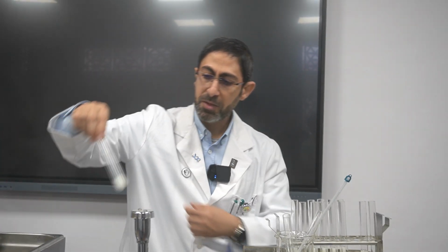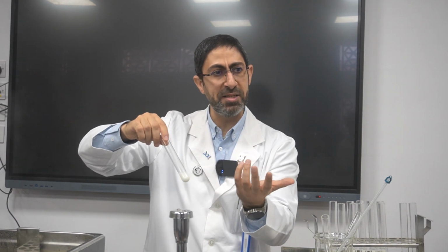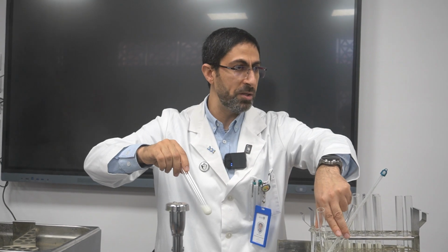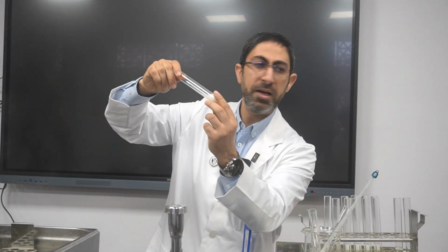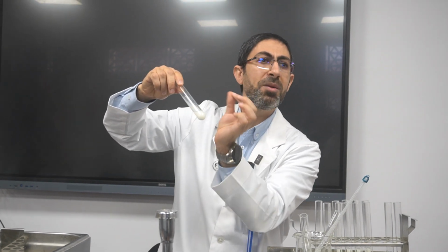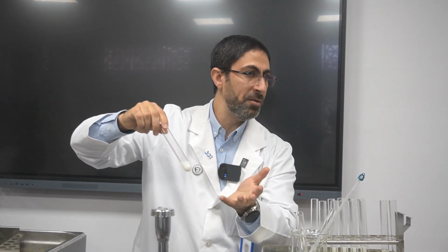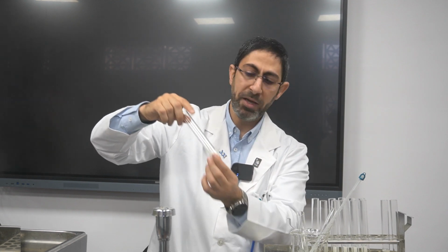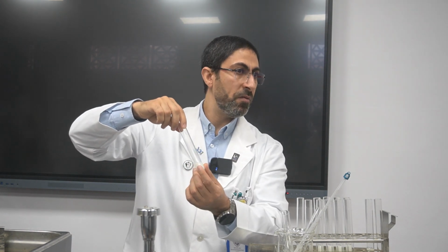I have also another point to tell you, as a trick while using it. You can rotate the tube from time to time. Myself, I would say at 3 minute intervals, among the 20 minutes total in each water bath. When you rotate the test tube, small clots will be there. It is an indication of the starting of the breaking down of the casein milk into amino acids. So you can also use it as a point of determination of the start of the reaction.